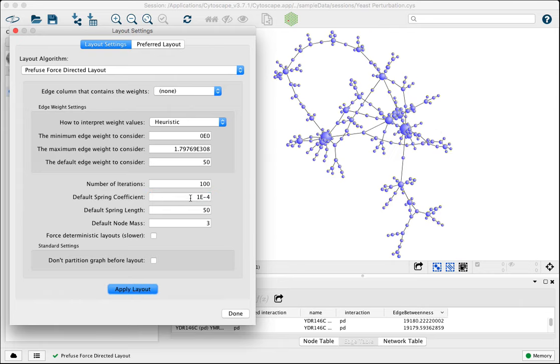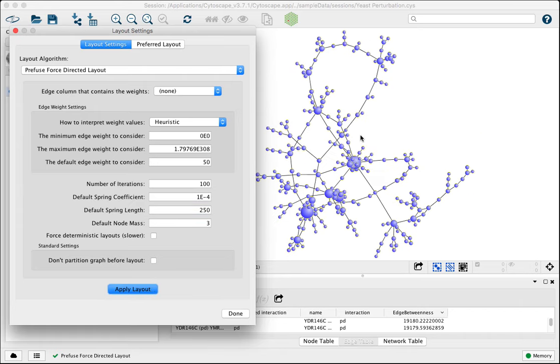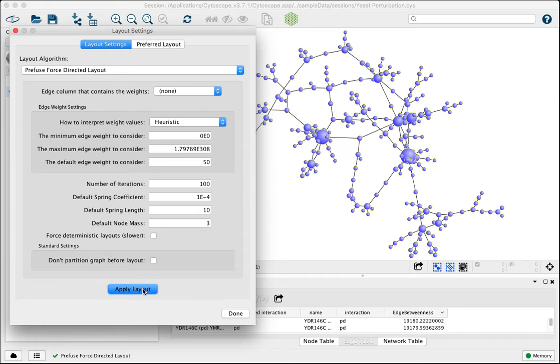In addition to the spring coefficient, you can also tune things like the default spring length. This is basically how long that spring should be when things start out before the simulation is run. So it's currently set at 50. You can increase and decrease this. In units of 50 are usually pretty useful. So here I'll jump by 100 and you'll see things are more spaced out. Just jump another 100, we get more spaced out. If we went the other direction, decrease this to 10, things are going to be a little tighter together. So let's leave this at like 150.